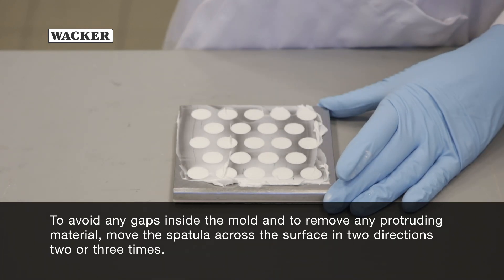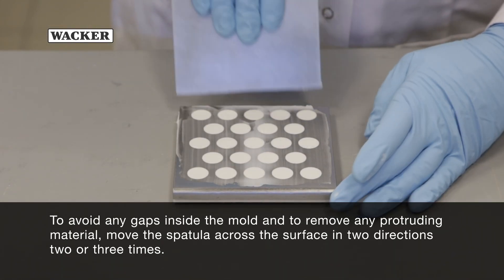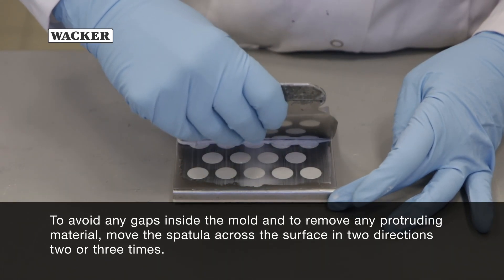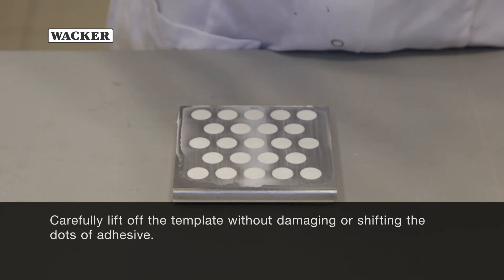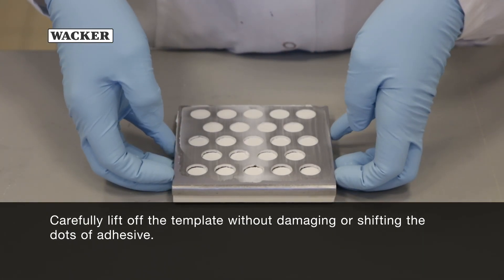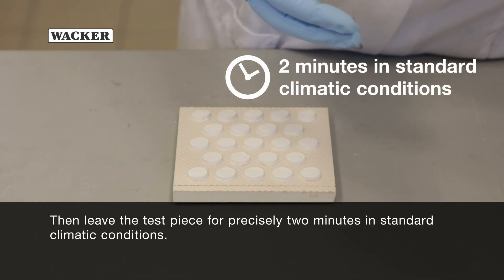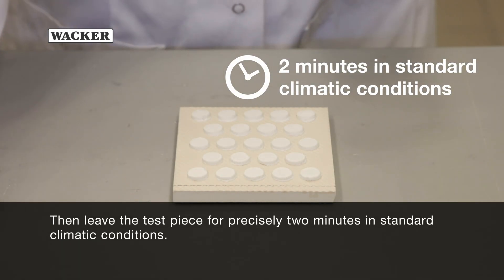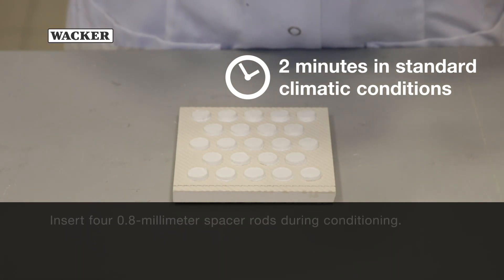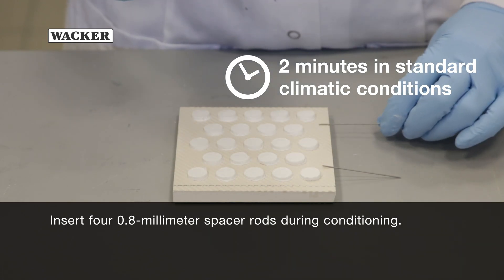To avoid any gaps inside the mold and to remove any protruding material, move the spatula across the surface in two directions two or three times. Carefully lift off the template without damaging or shifting the dots of adhesive. Then leave the test piece for precisely two minutes in standard climatic conditions. Insert four 0.8 millimeter spacer rods during conditioning.